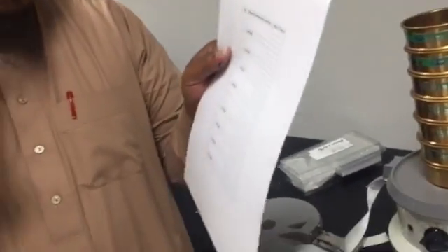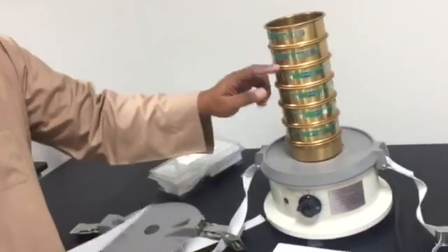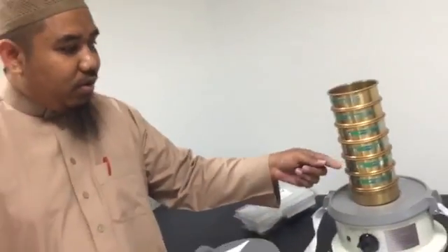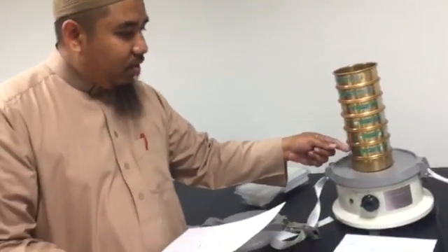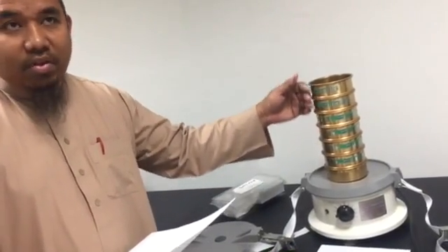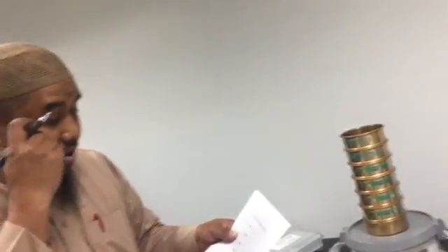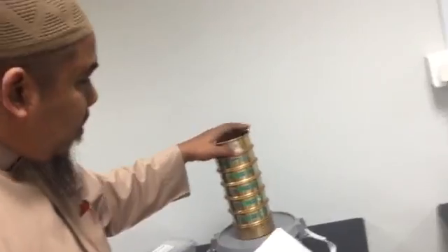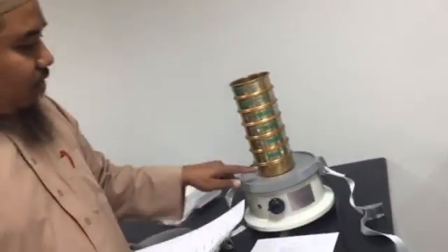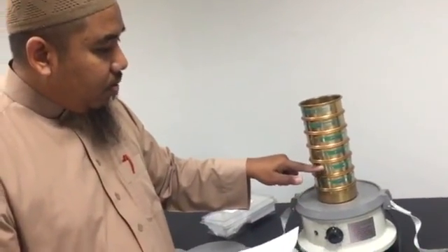Now the second one, angle of repose. From this, you take, let's say, this sample and this sample, 4 of this size, and see which one is most. For example, you will get most at the bottom, and here might be less.